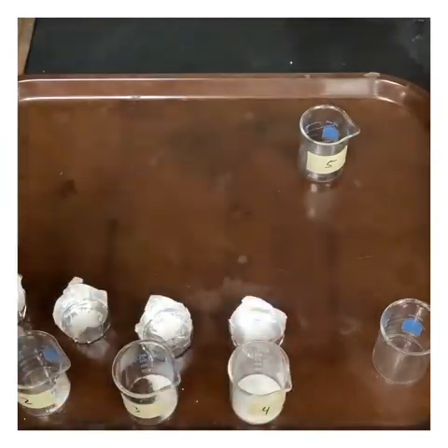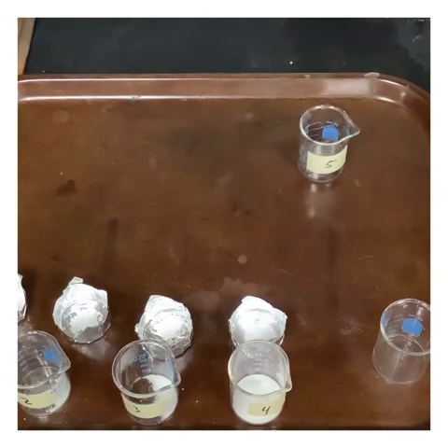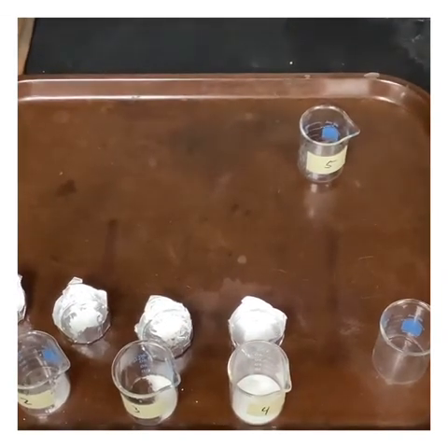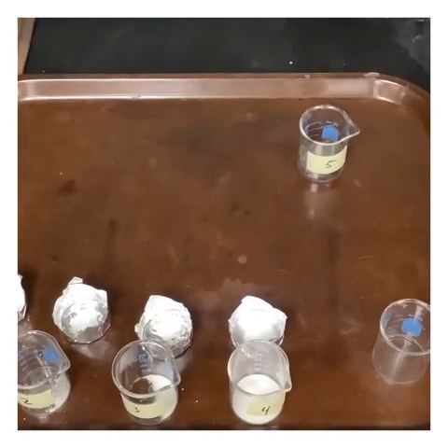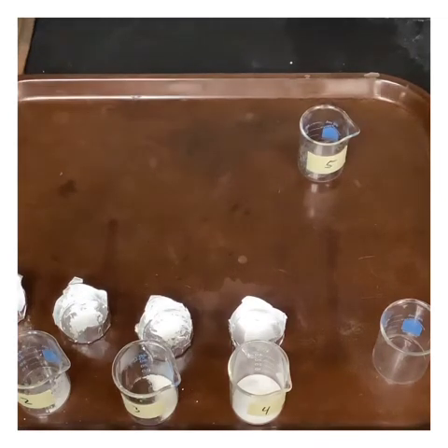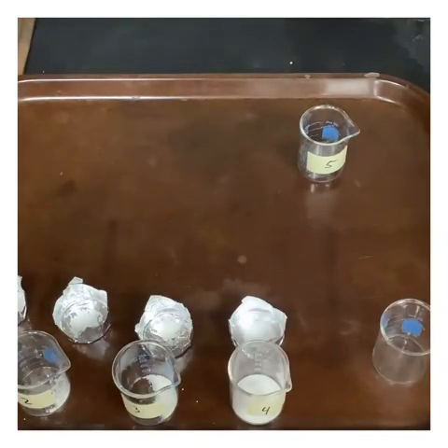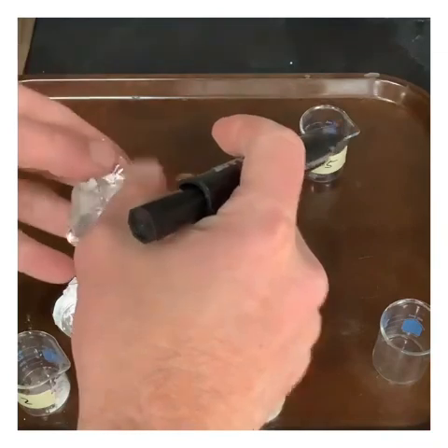I didn't label the aluminum foil, so I think what we can do is get a Sharpie. Yeah, I'll get a Sharpie. I was going to say we'll just keep them straight on the hot plate, but it's pretty easy for us to Sharpie it up here.